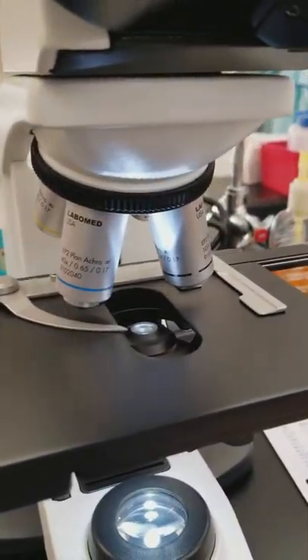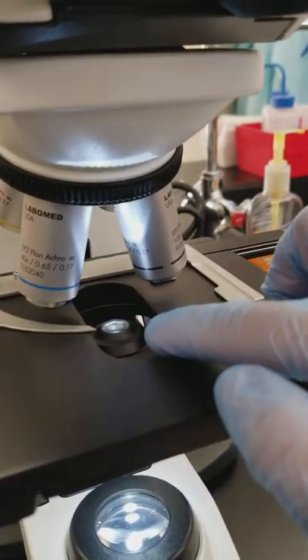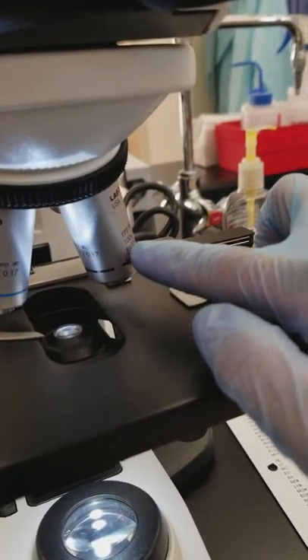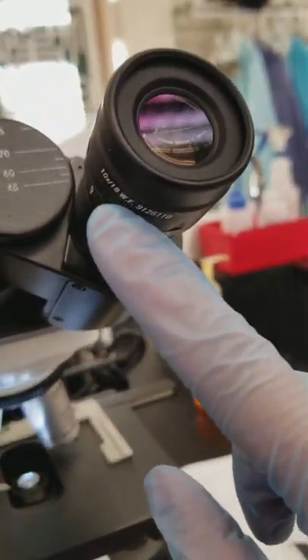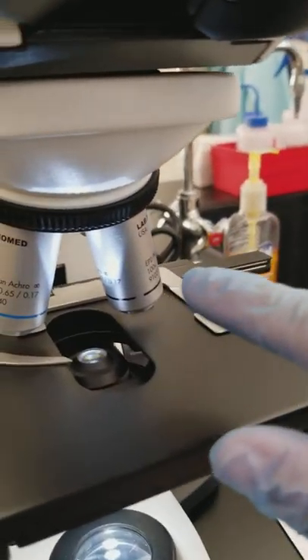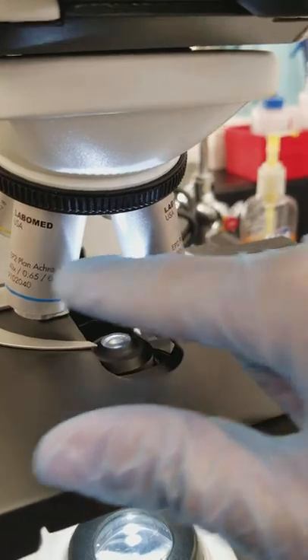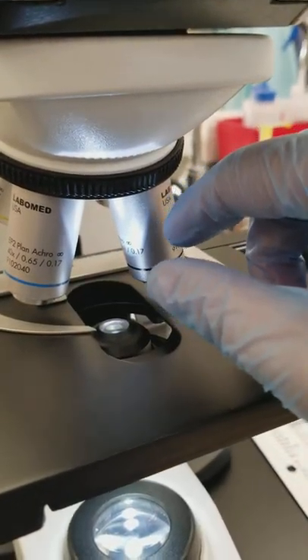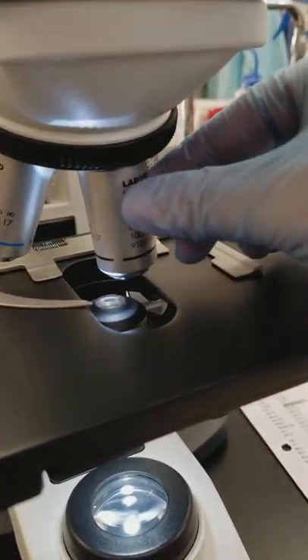The condenser is showing light between the oil 100, which is also known as 1000 because of the 10x that you get with the ocular. I've got it moved away. You could also have done it this way in order to move it towards the 10.